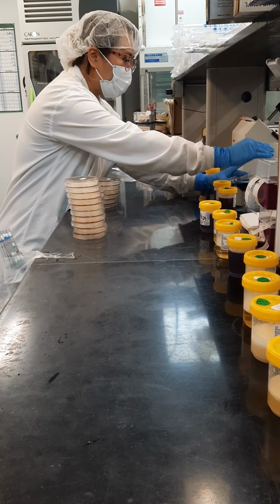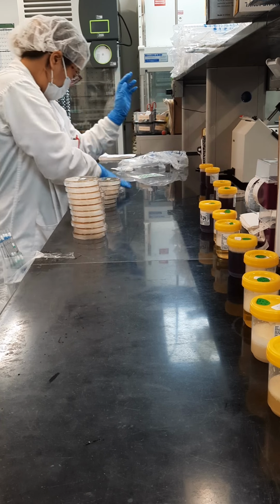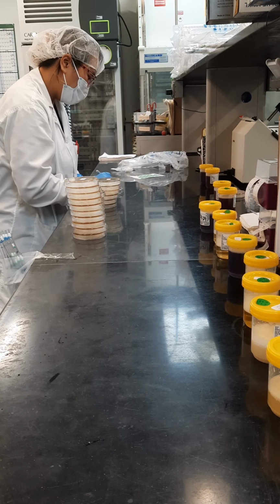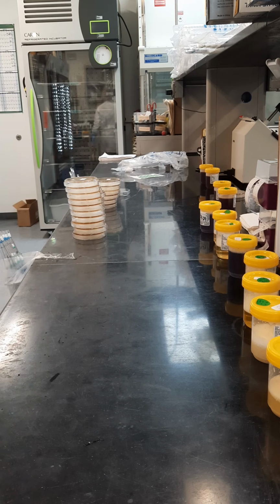And then you lose the plate sometimes. Luckily that was a control, so I just re-pour that one. TSA plus control. Here is an example of mistakes that happen, but so long as you're able to correct it, you just conduct the test one more time, making any corrections that need to be made.